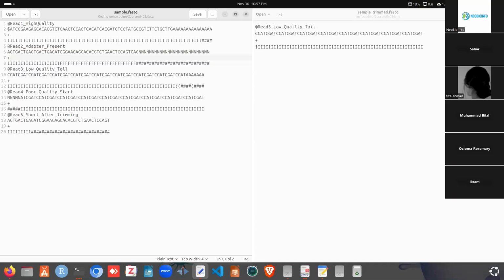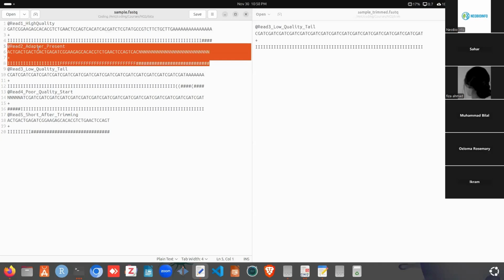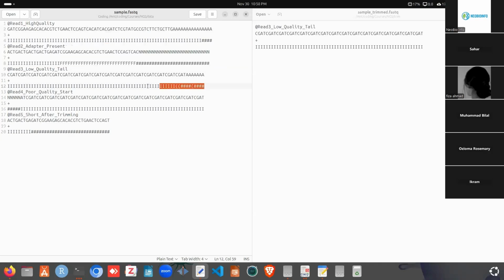So LEADING cuts or trims the bases from the 5' end. This is the 5' end, 5' to 3'. It goes left to right, and if it finds any low quality bases, it will remove them. We specified the leading threshold as 3. If we take read 1, it contains I, which has the quality score 40, and 40 is greater than 3, so it won't perform the leading trim for this read. So read 1 will be as it is. Read 2 will also be as it is, since it contains the first base as I. The third read will be as it is.